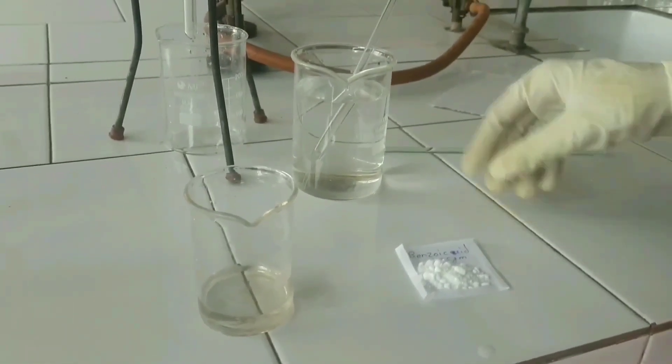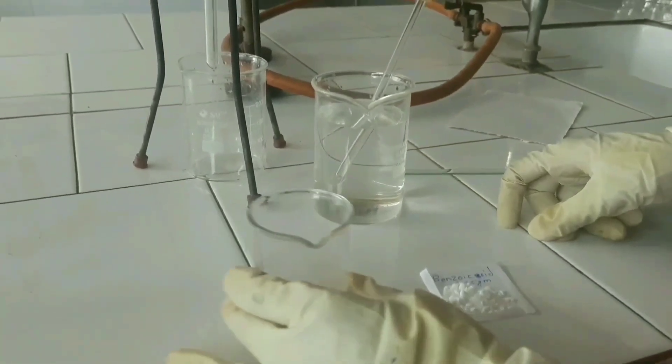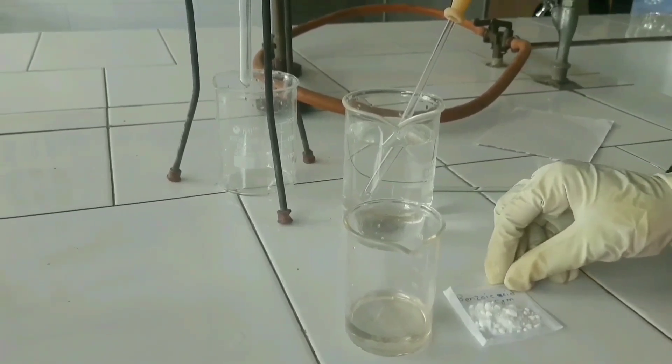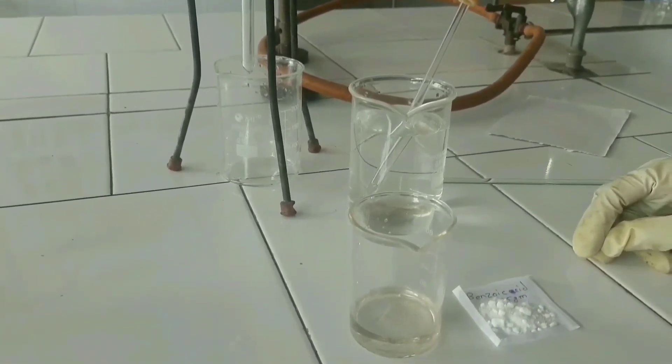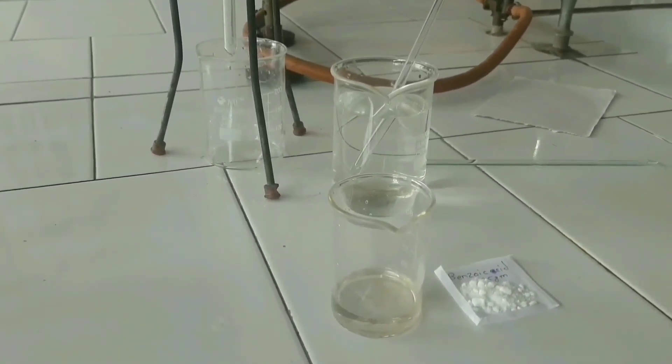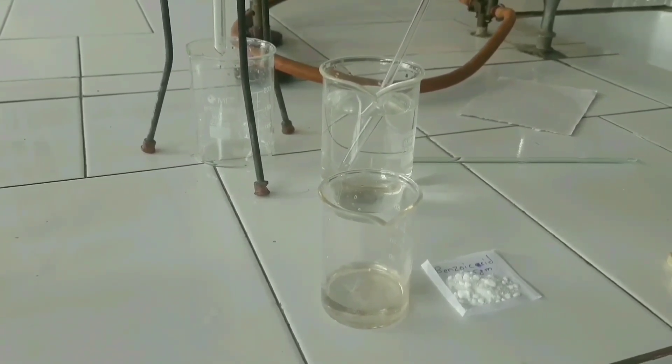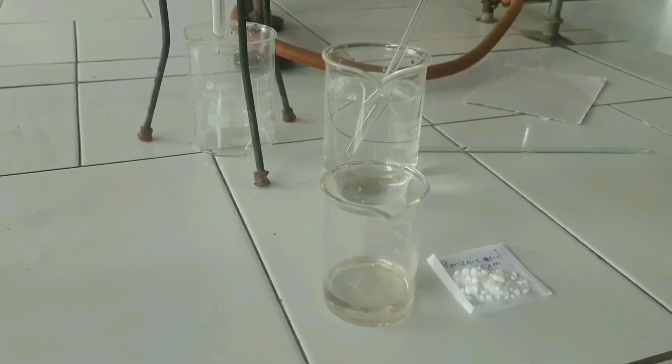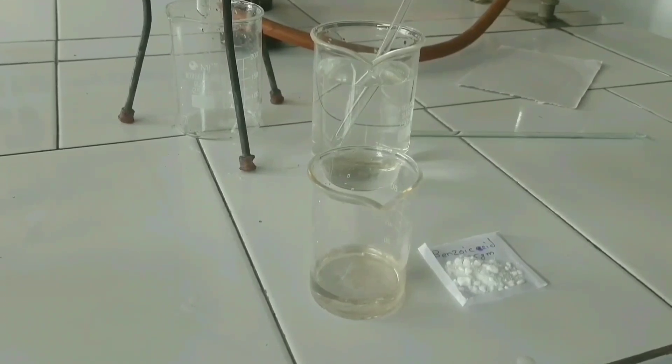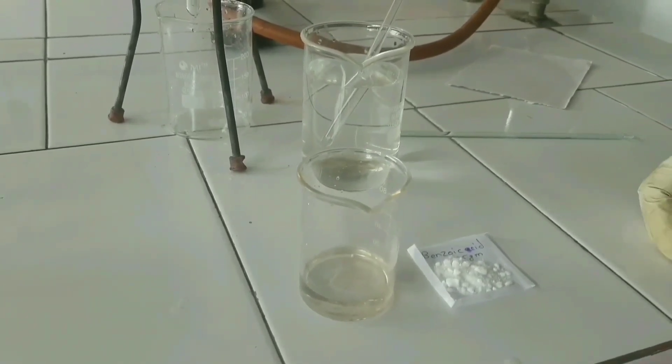First procedure: benzoic acid is an organic acid which is insoluble in water. Therefore, propylene glycol is used as a co-solvent. Benzoic acid is soluble in propylene glycol which is miscible with water.